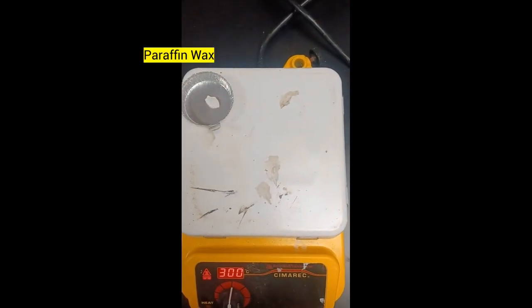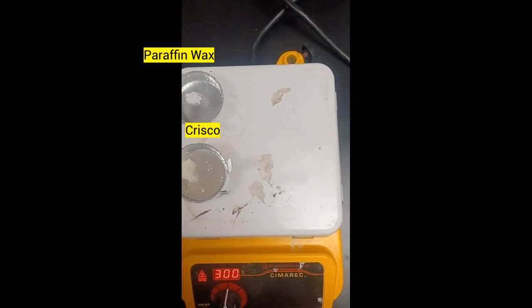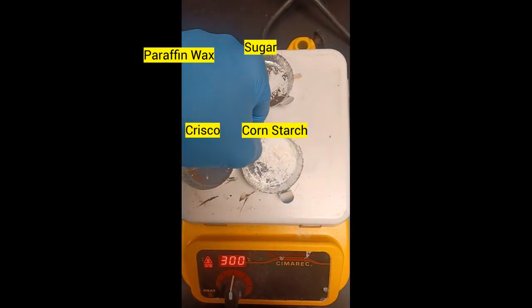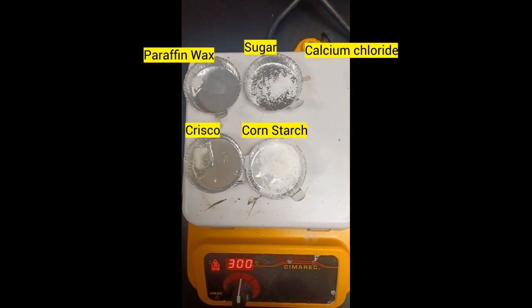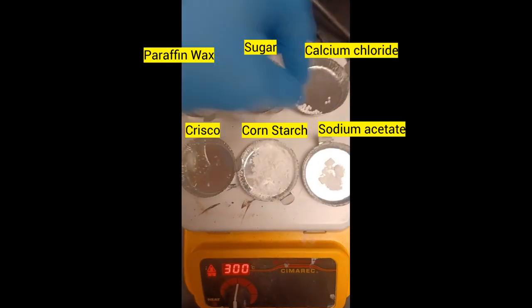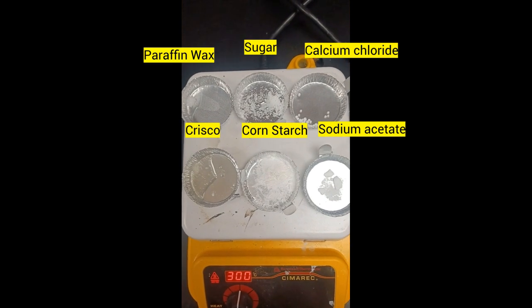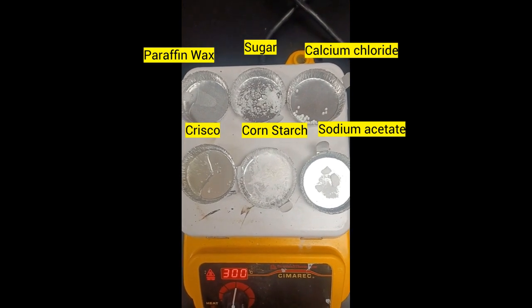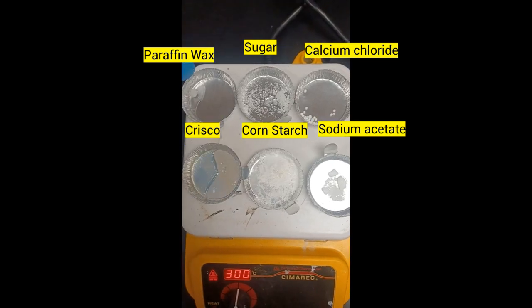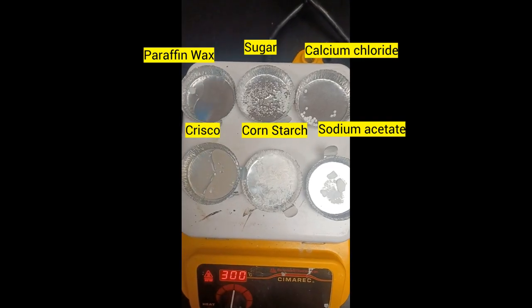So the paraffin wax is on, the Crisco is on, the sugar is on, cornstarch is on, the calcium chloride is now on, and the sodium acetate is now on. So let's see if they melt. You can kind of already see that some samples have indeed melted. I can see that this paraffin wax over here has already pretty much melted. It still has a little bit to go there at the edge.